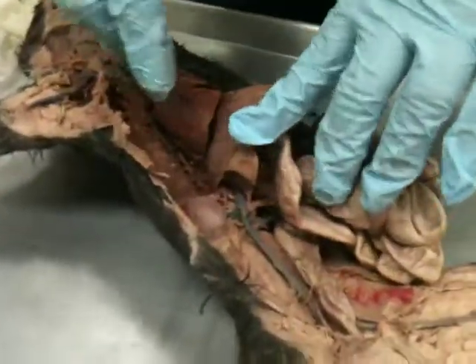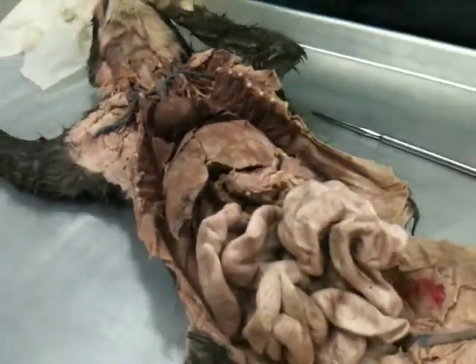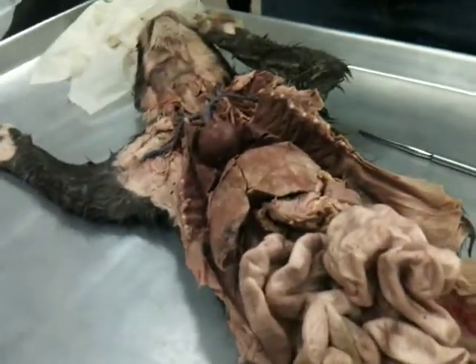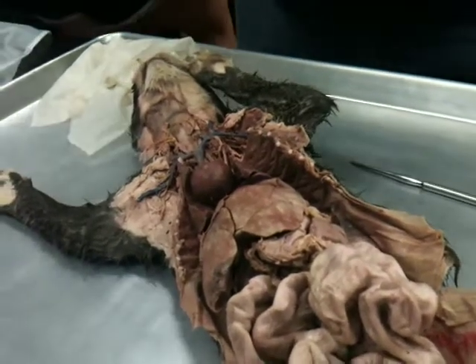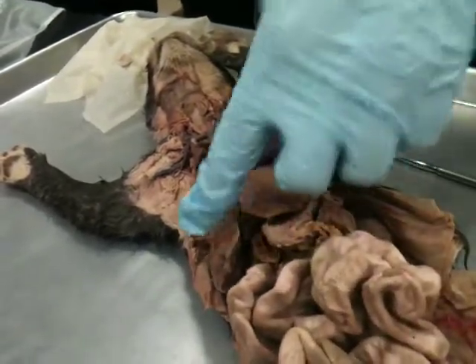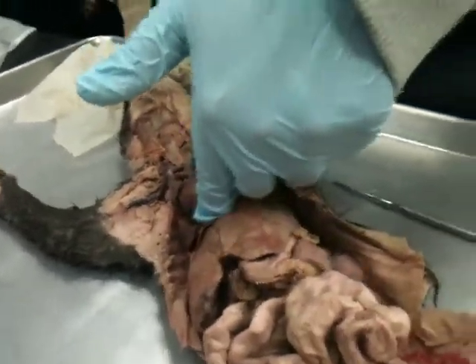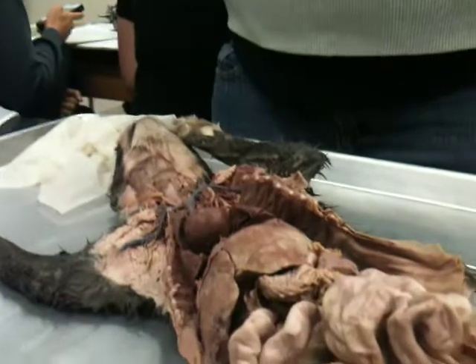Okay, so we had the azygous, then we can come back. Remember, in the liver, we have the hepatic veins, which are all these branches that are allowing us to filter the blood, because the liver's purpose is to filter toxins from our bloodstream. Okay, so it's going to take that deoxygenated blood, branches from the inferior vena cava here and the hepatic portal vein into all the hepatic veins. The blood gets filtered and then it comes back into that inferior vena cava where it goes into the heart. Okay, so you can't see those hepatic veins, but know that they're referring to the liver.